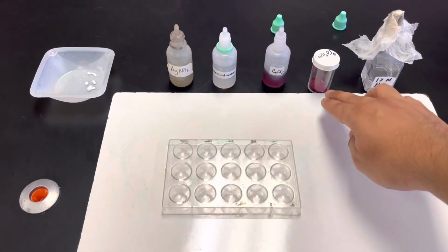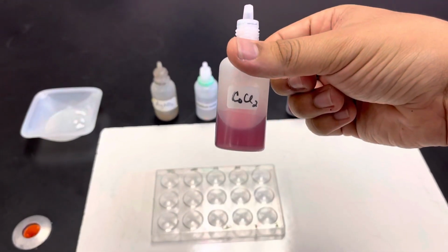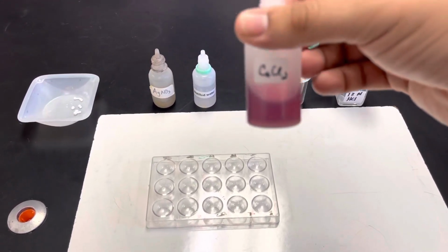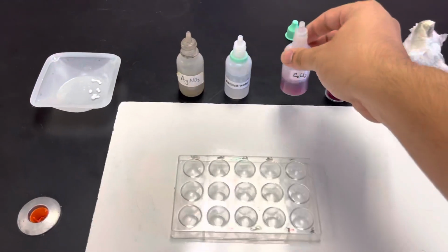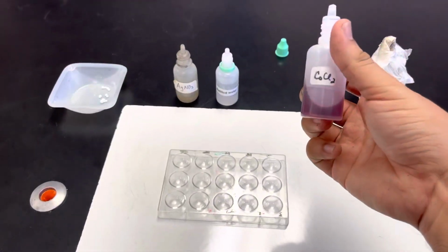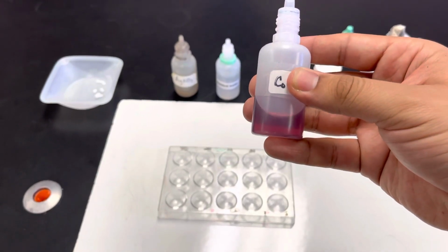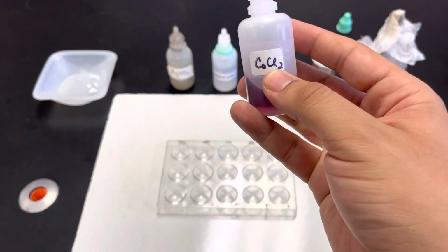All right, so for this lab, we're going to be looking at this cobalt chloride. This is the cobalt chloride hexahydrate dissolved in ethanol, actually, instead of water. So that forms the cobalt hexahydrate compound. I guess this is like a cobalt ion surrounded by 6 water molecules, basically. So it really shouldn't say CoCl2 on here.